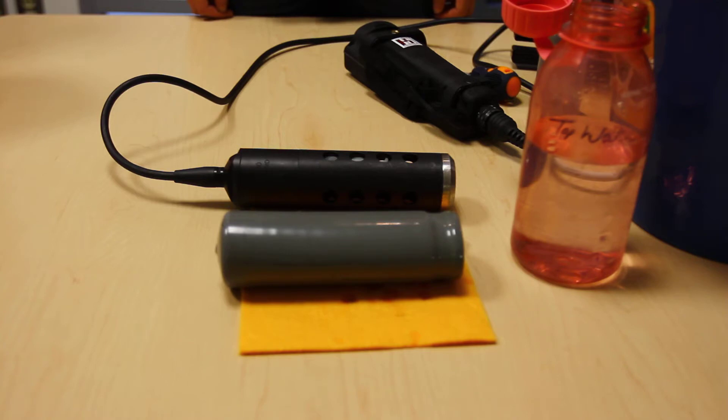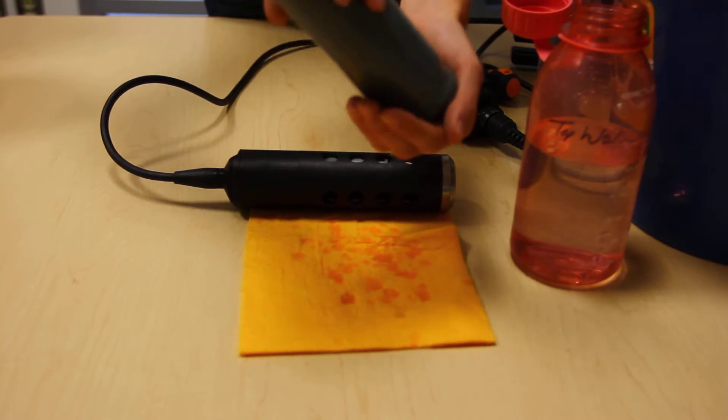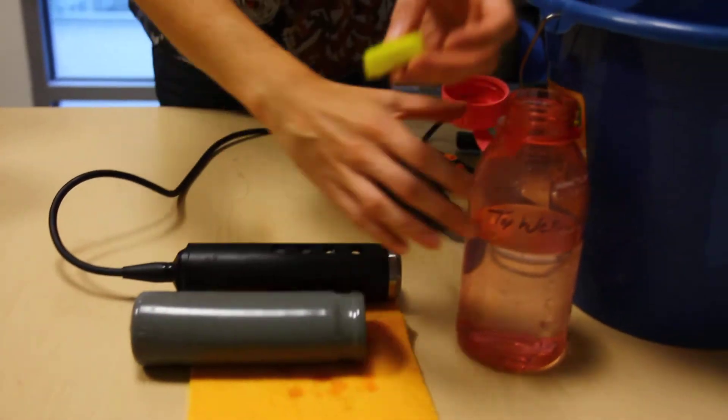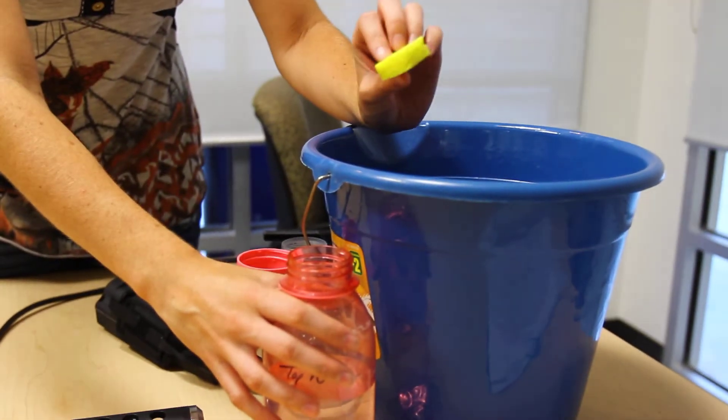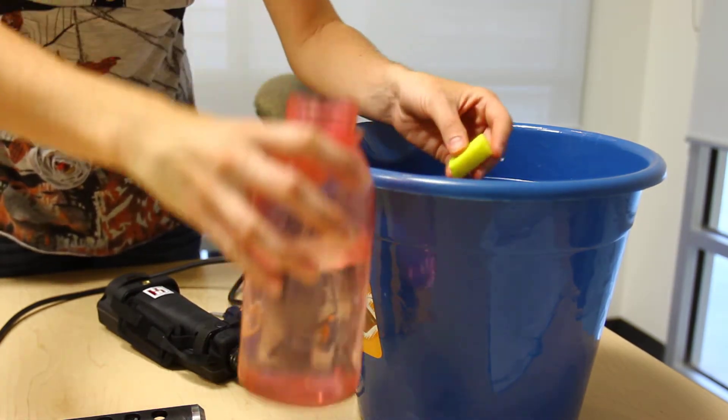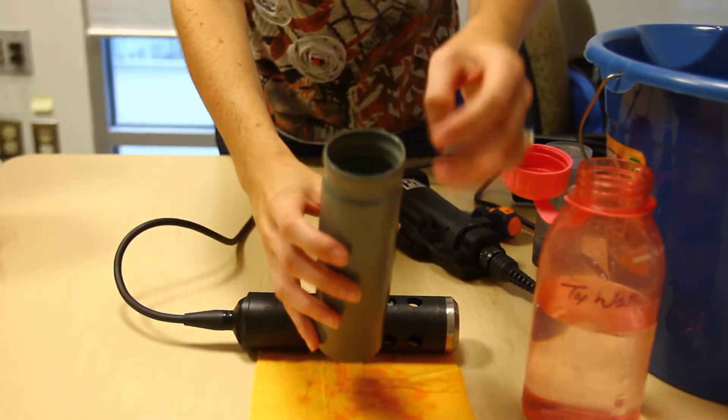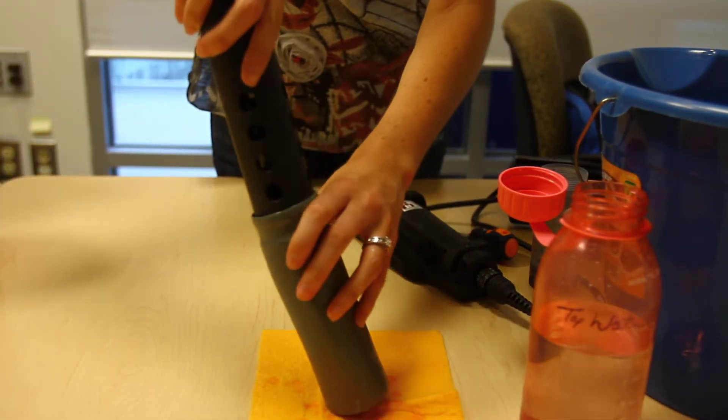If your sampling frequency is less than two weeks, you can place it in your gray sleeve with a moist sponge. Look to see if the sponge is molded or has dirt on it. You can ensure that it is fully saturated, place it in the gray sleeve, and you can have your sensor guard placed in there.